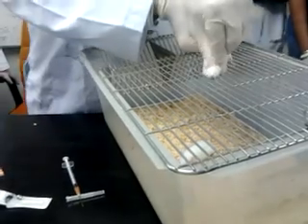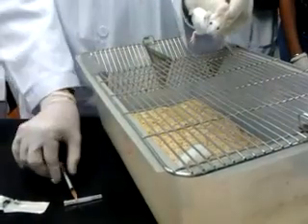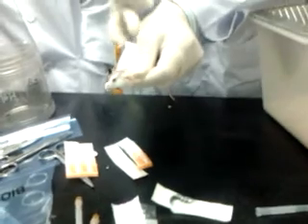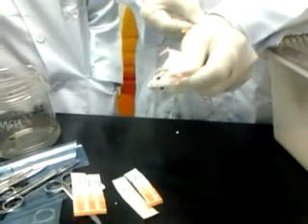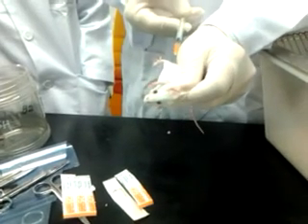See how they squeeze the animals. They're confident. This is a muscle mass here. When you give muscle, you have to give the IM. Use your hand here to support your needle so it doesn't move. Place it here. Make sure the bevel faces up. Go to the muscle mass here.